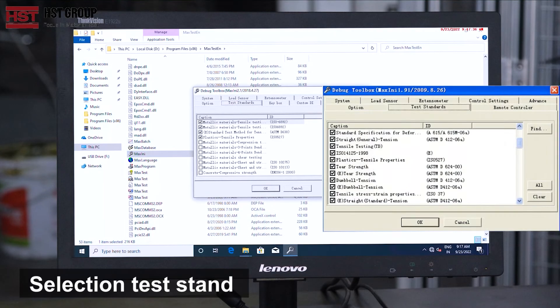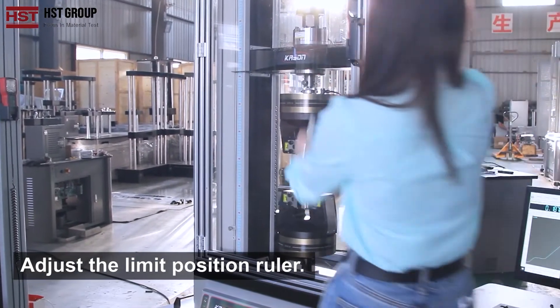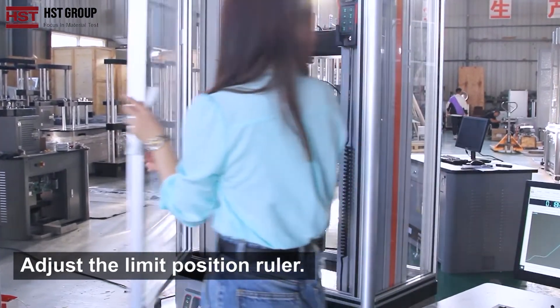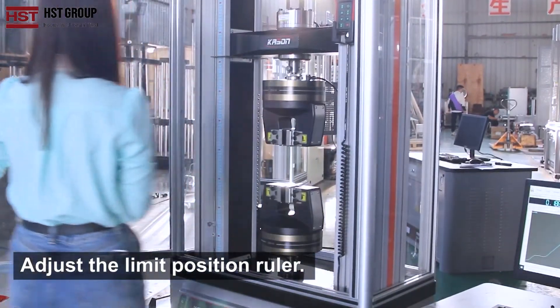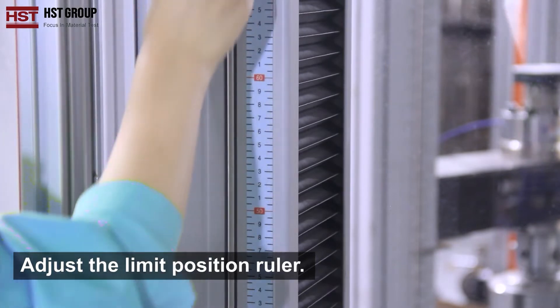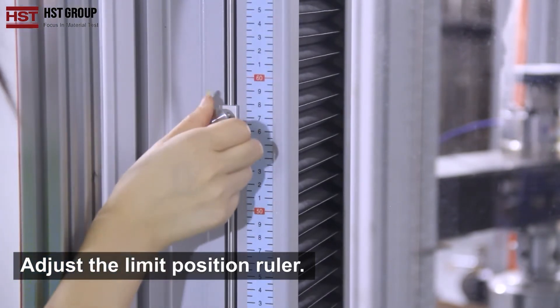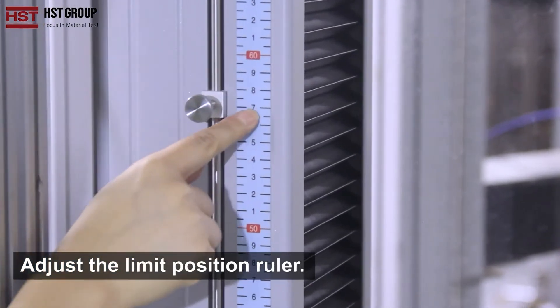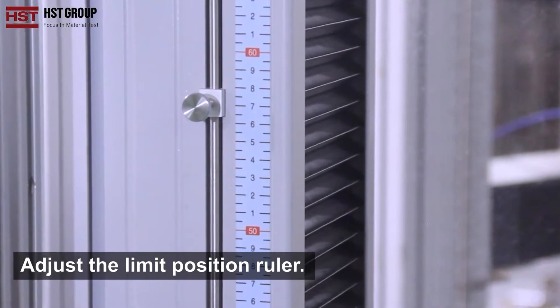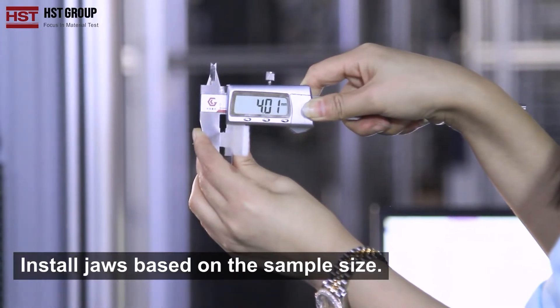Select the test standards. Adjust the limit position ruler. The distance between the upper limit position ruler and the buffer should be at least 10 mm less than the distance between the upper and lower compression plates. The same applies for the lower limit position ruler. Install grips based on the sample size.